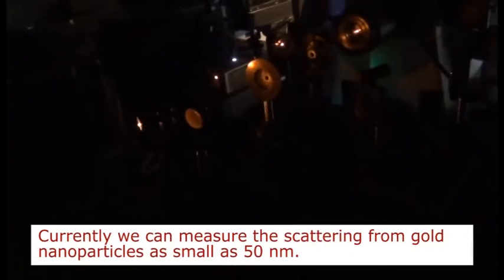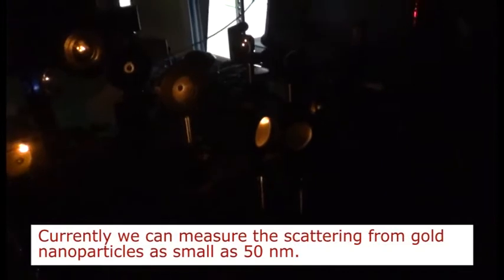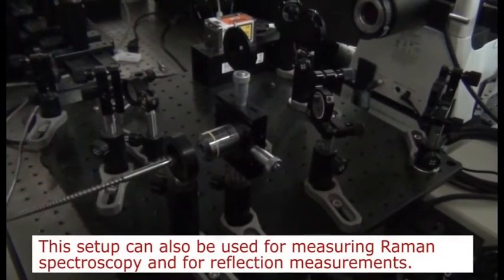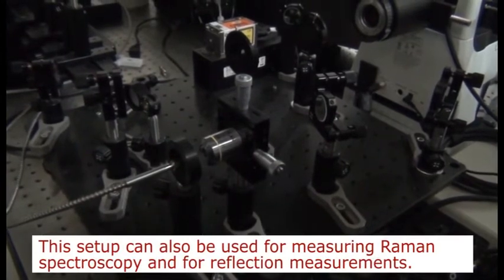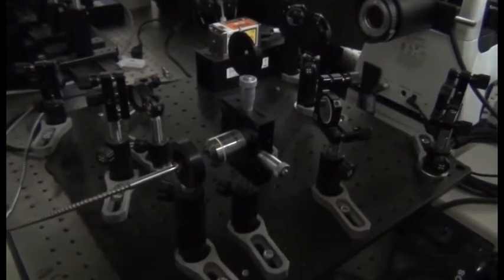The collection side of the setup has a 60x air immersion objective with a numerical aperture of 0.65. What this does is, by choosing this appropriate numerical aperture of the objective to be less than that of the condenser, we are only collecting the scattered light. Then this image is translated either to a visible camera, which is on the left hand side port, or to the spectrometer, which is on the right hand side port. Once the light is transmitted through the lens system to either of these parts, we can take an image or measure the spectrum of the single particles that we are interested in.